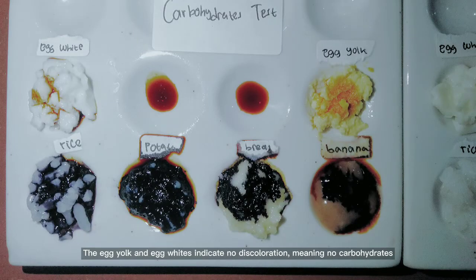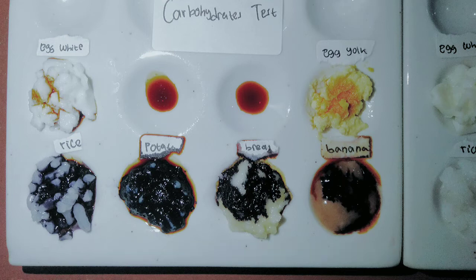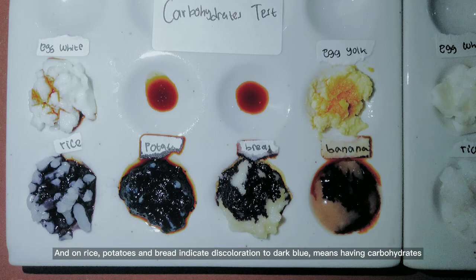The egg yolk and egg whites indicate no discoloration, meaning no carbohydrates. The bananas indicate discoloration to dark brown, which means having low carbohydrates. And on rice, potatoes, and bread indicate discoloration to dark blue, meaning having carbohydrates.